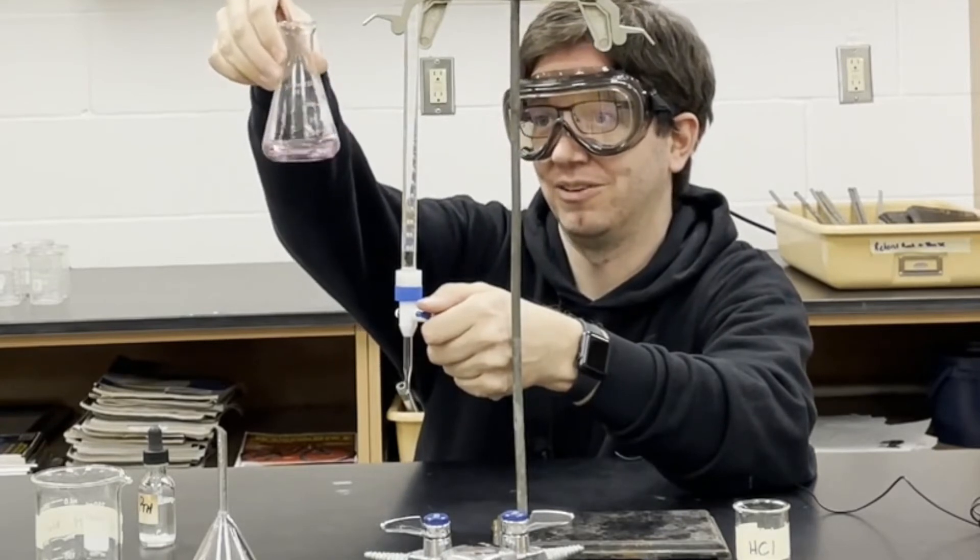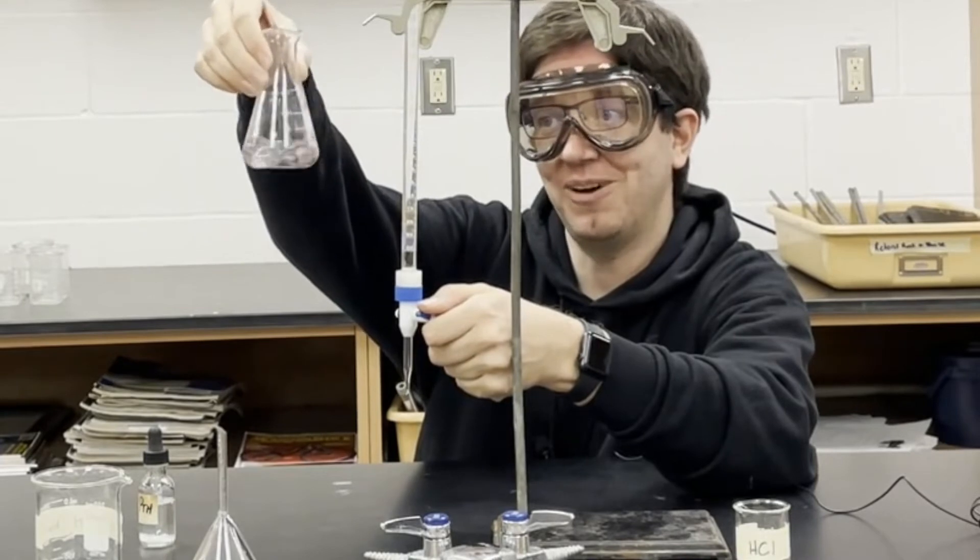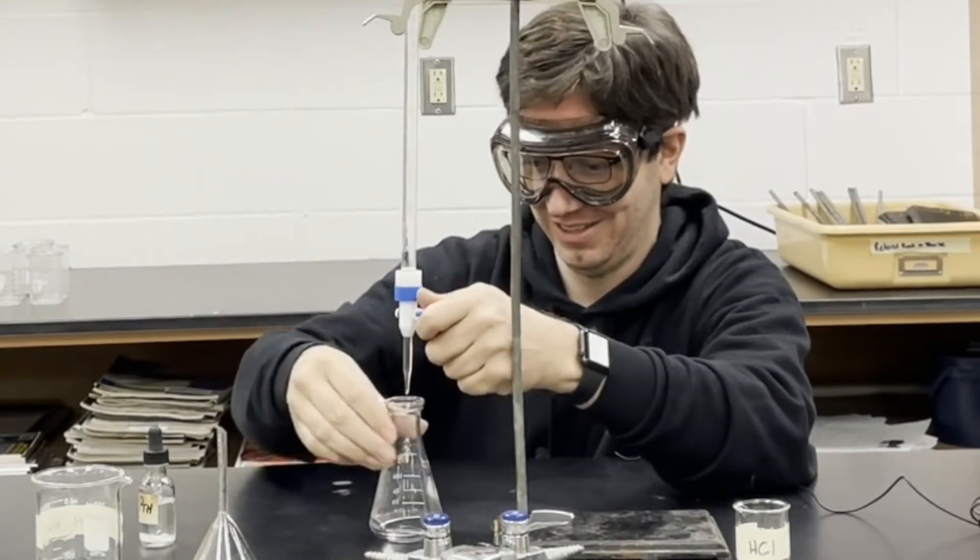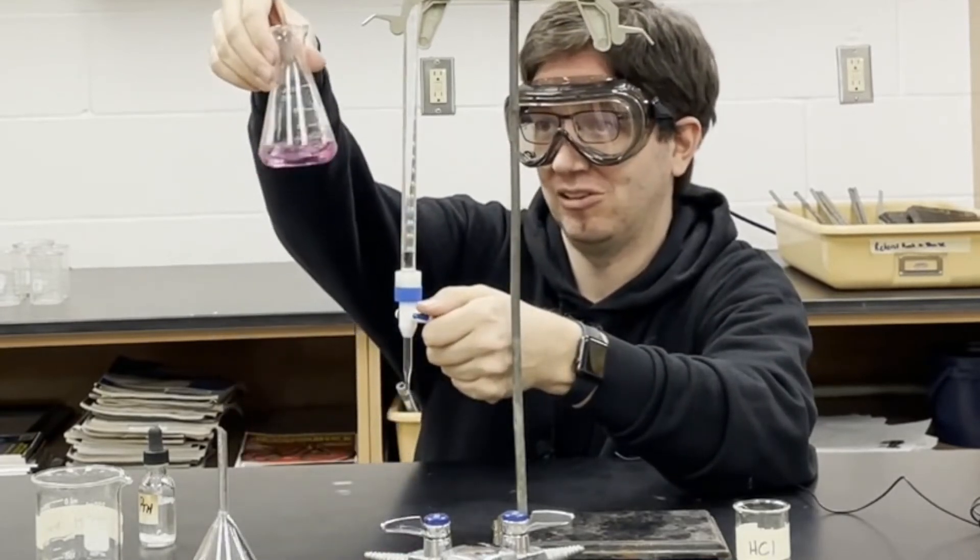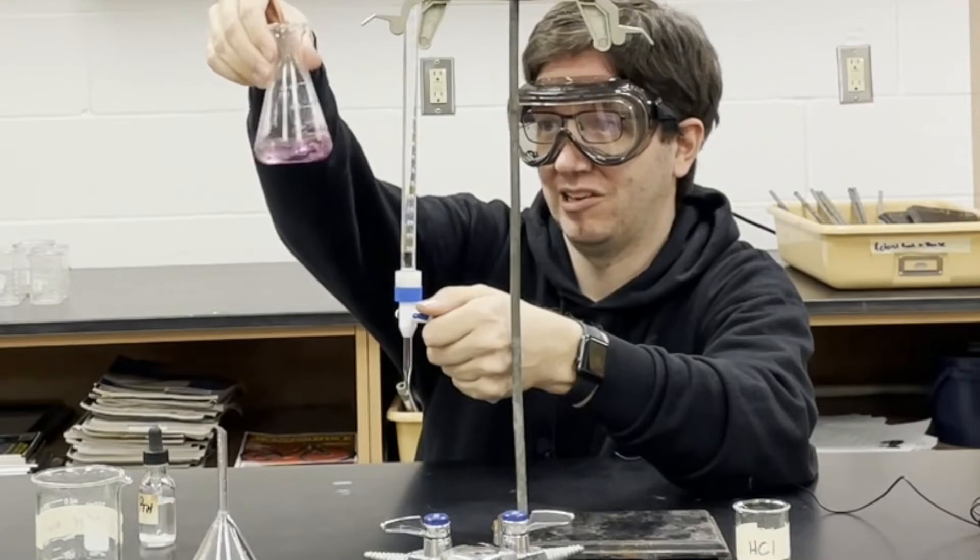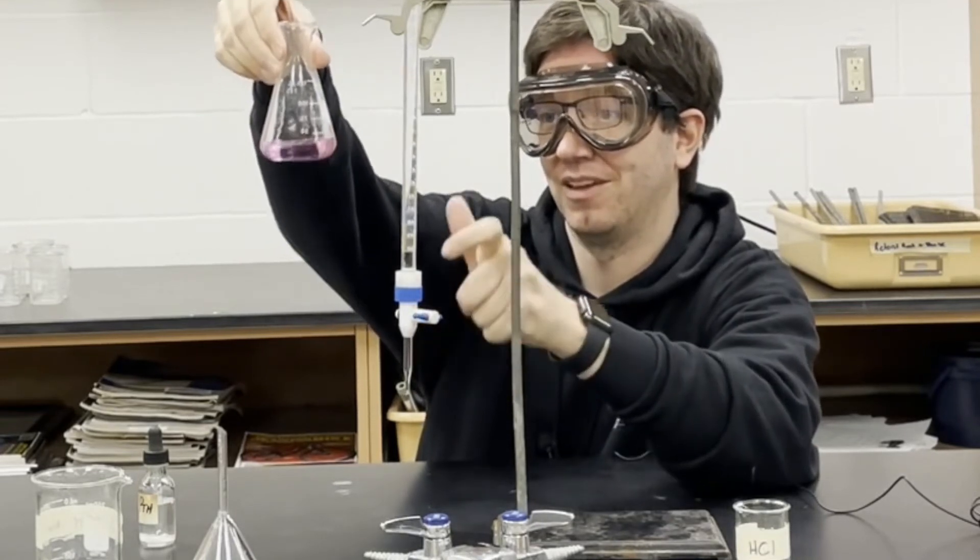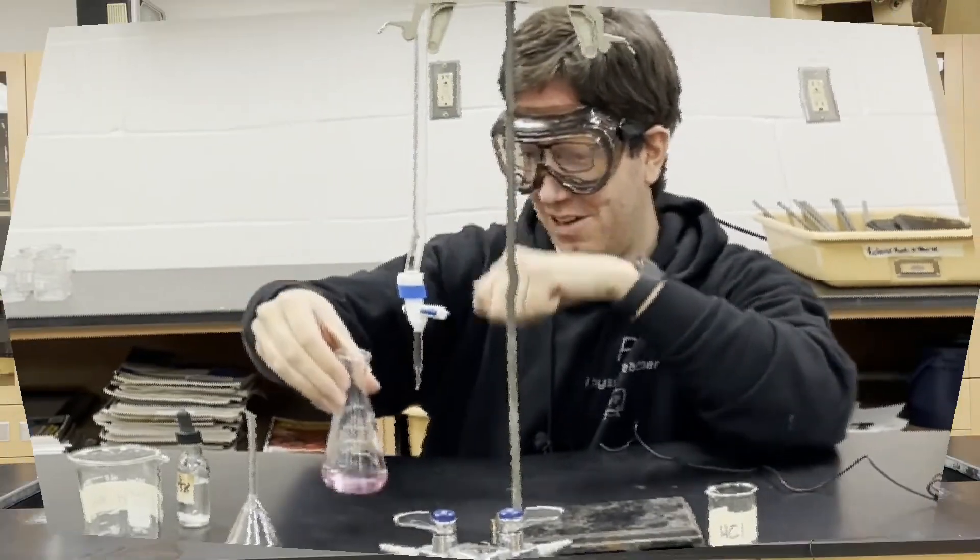There we go. Oh no, not quite. Just a little bit more. It went clear again. Just a little bit more. About now. Yeah, I think we're good there. Yep, we are good.